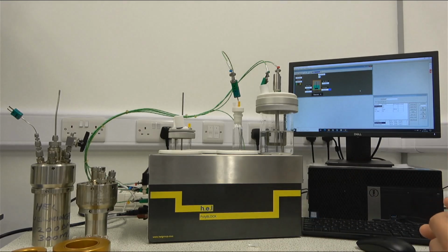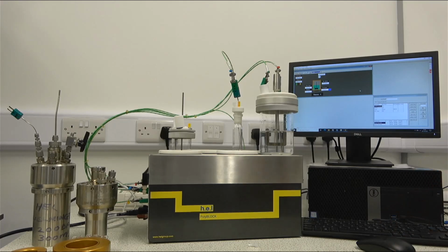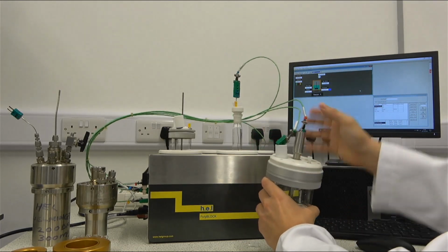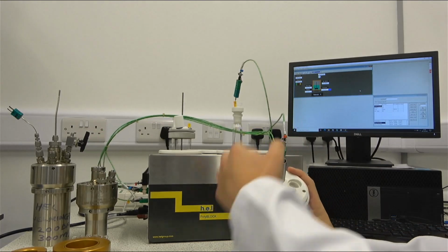Direct agitation is appropriate for when we have very slow agitation, as low as, for example, 50 RPMs, or when we have very viscous liquids. Other things that we can see in our reactors is that our lids are designed by us.